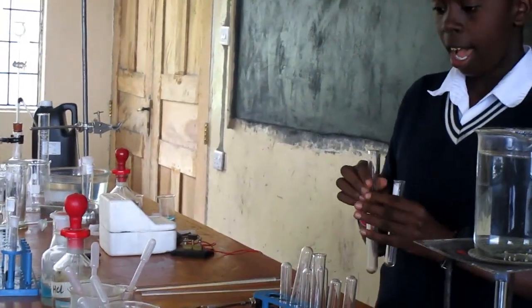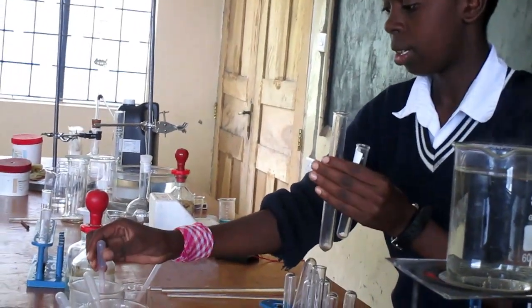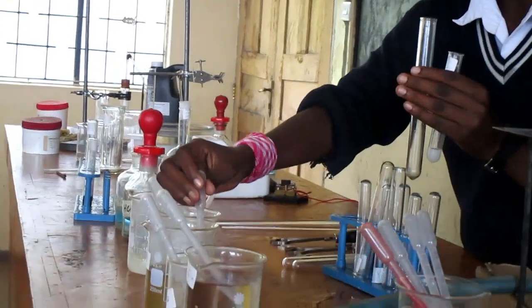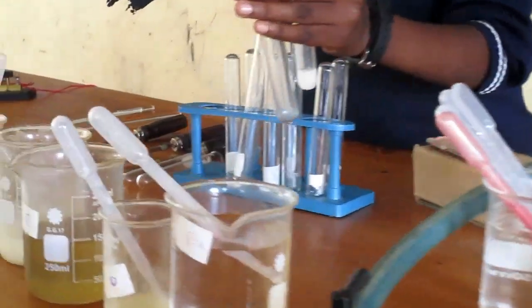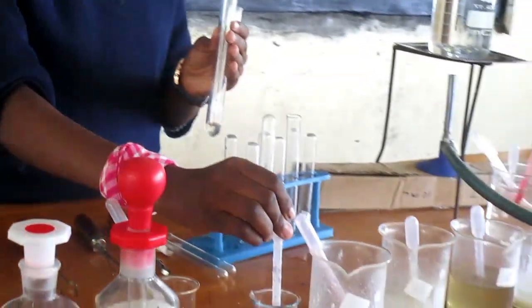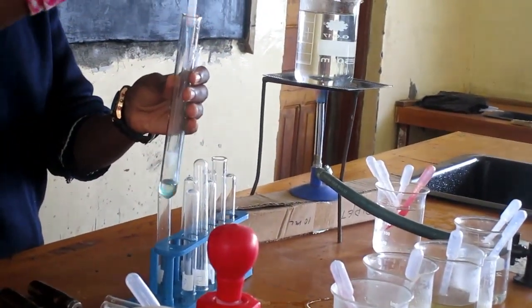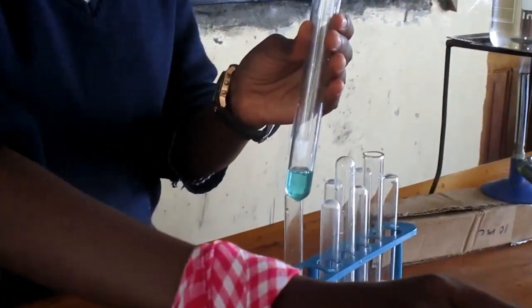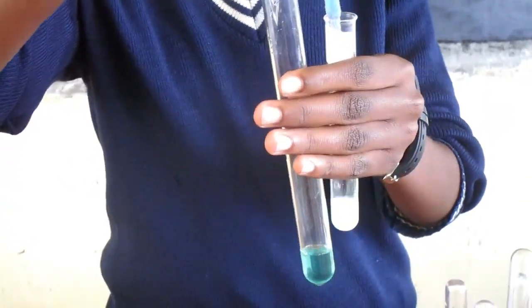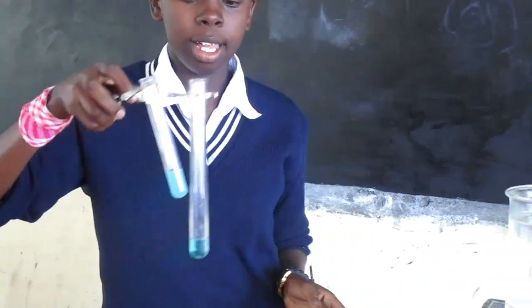We take our test tubes. Then we take food sample A and put it in a test tube. We take food sample C and put it in a test tube. After that, we take Benedict's solution and add the same amount to each food sample. We also add food sample B to its test tube. After that, we put them all in boiling water.